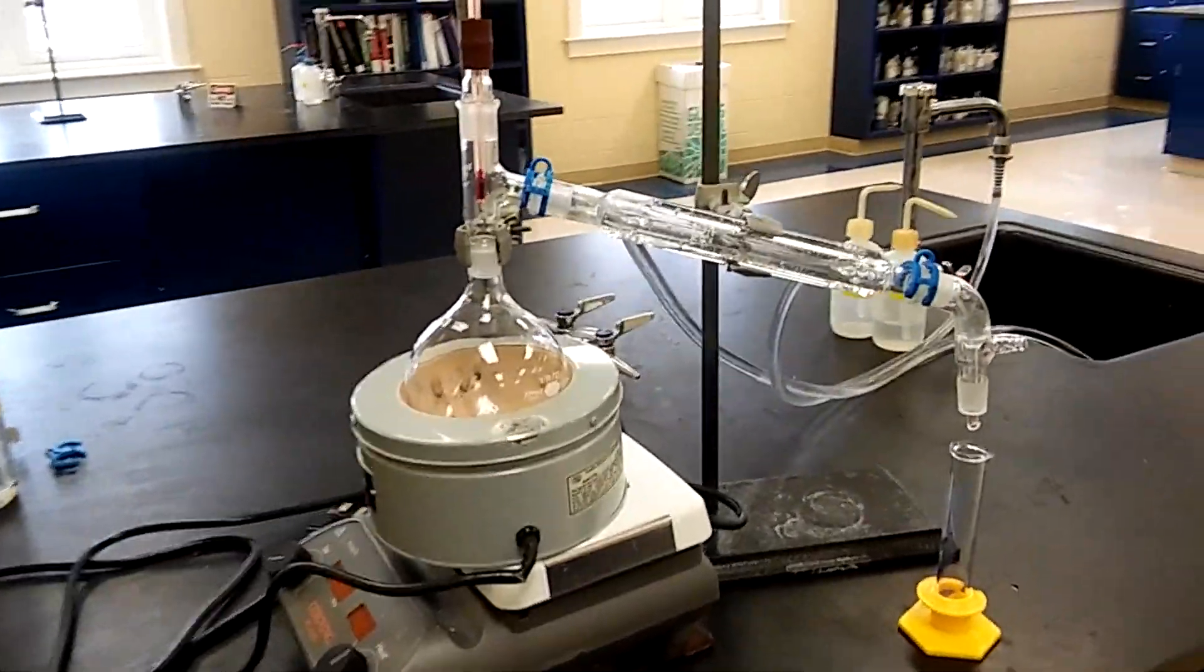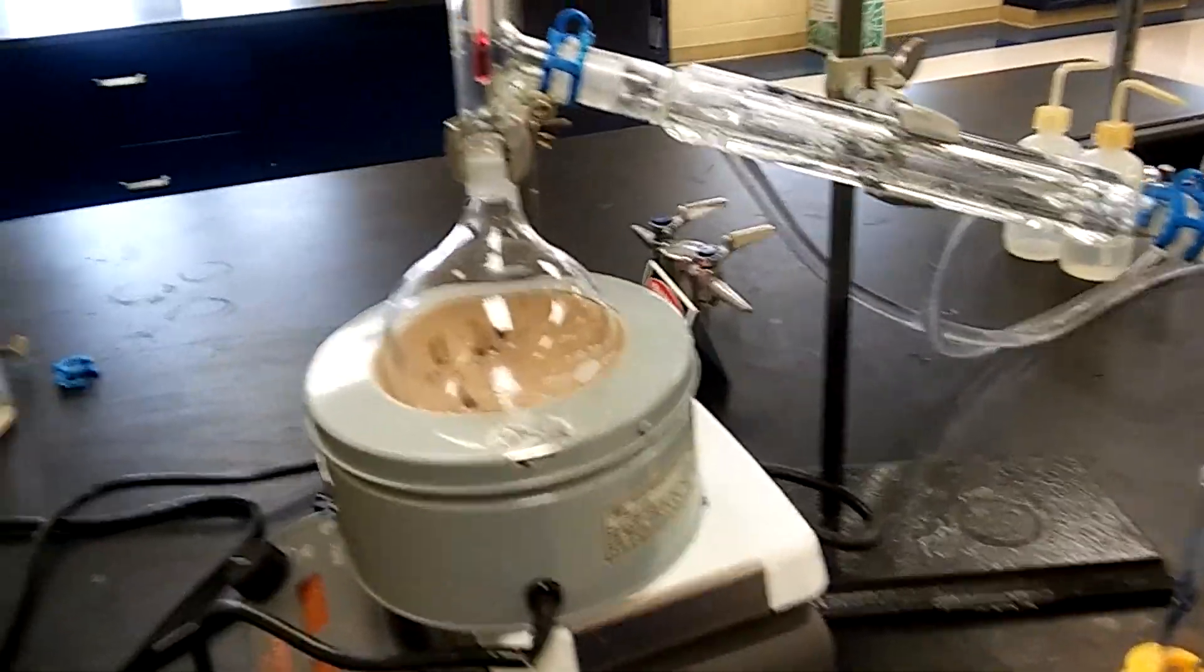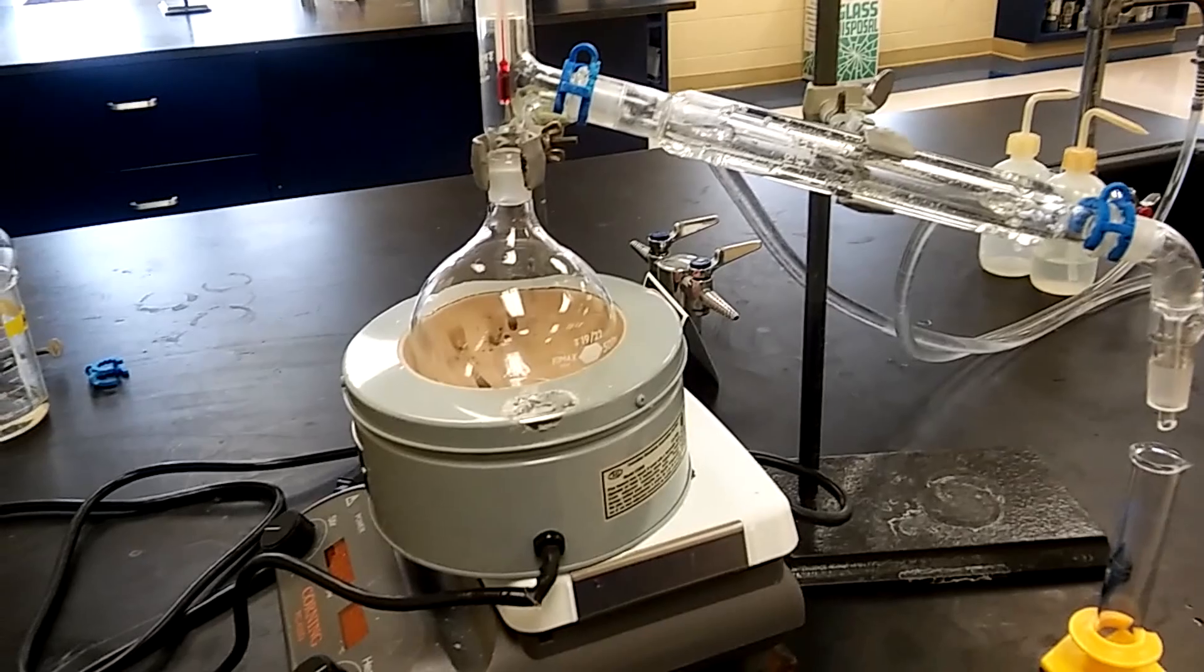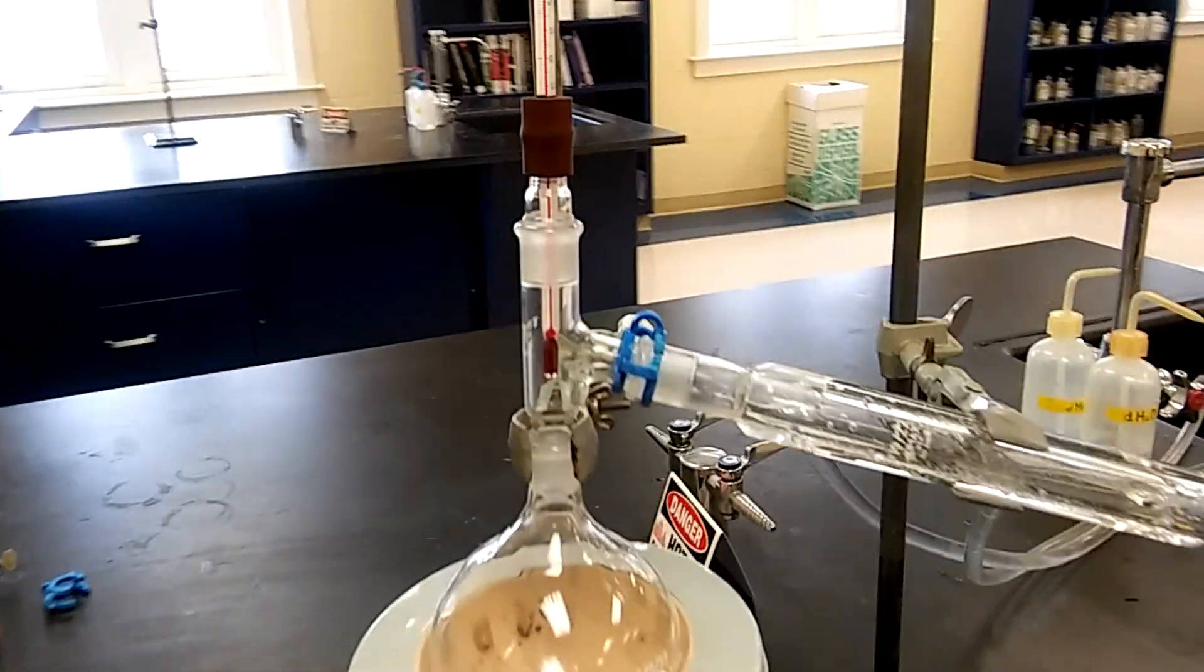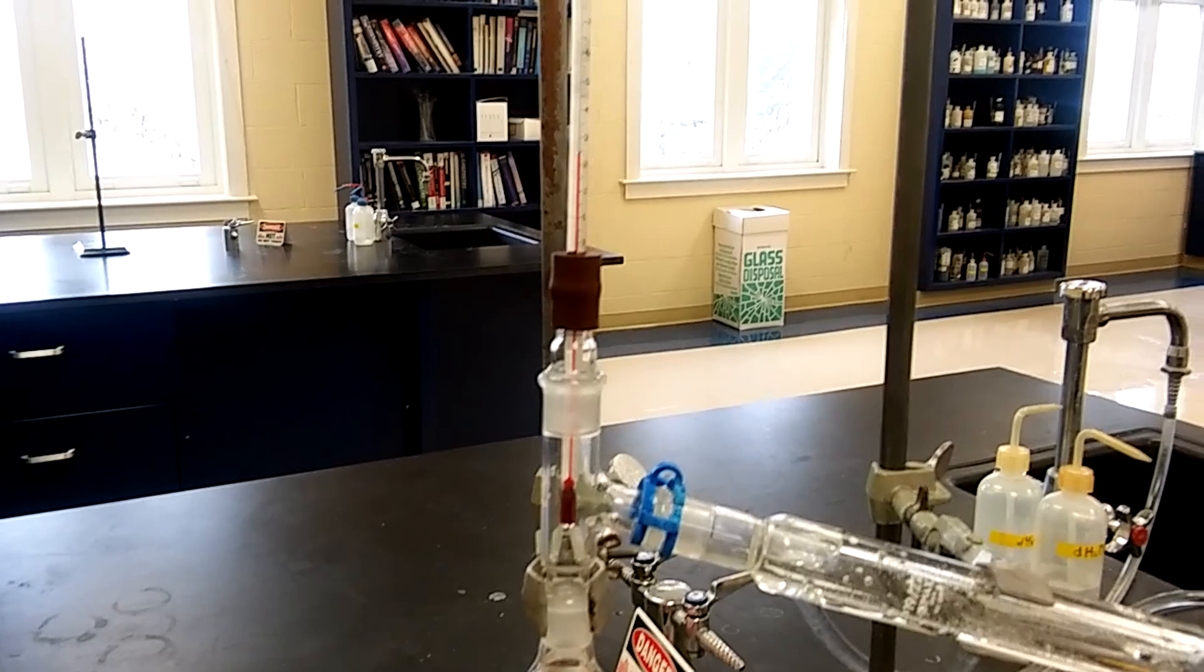I'm back now with the distillation setup. I got a 500 milliliter round bottom flask to which is attached a still head, and then one end of the still head is attached to the thermometer.